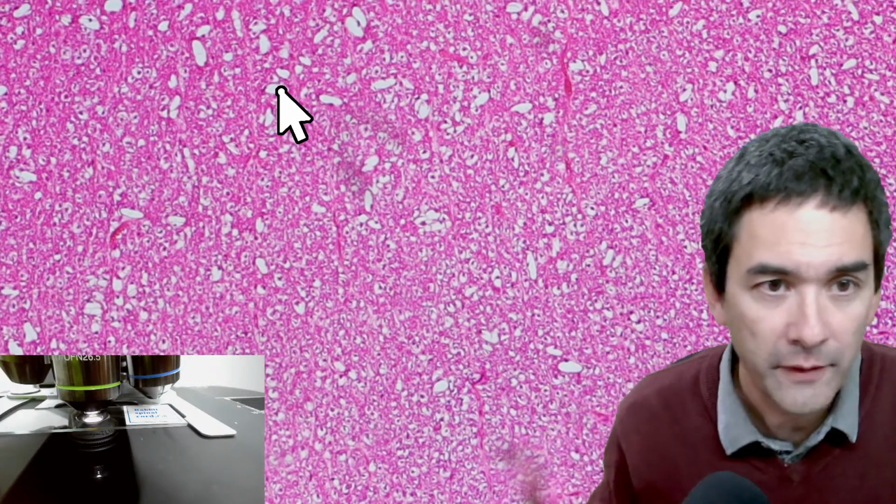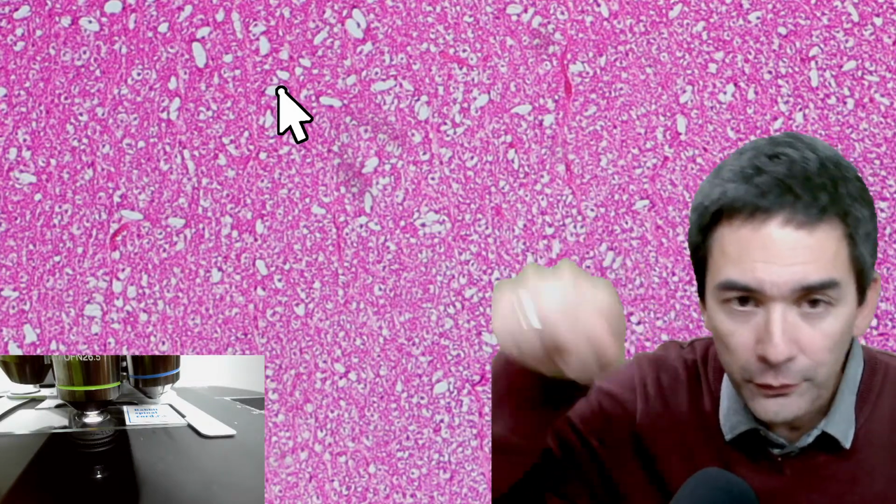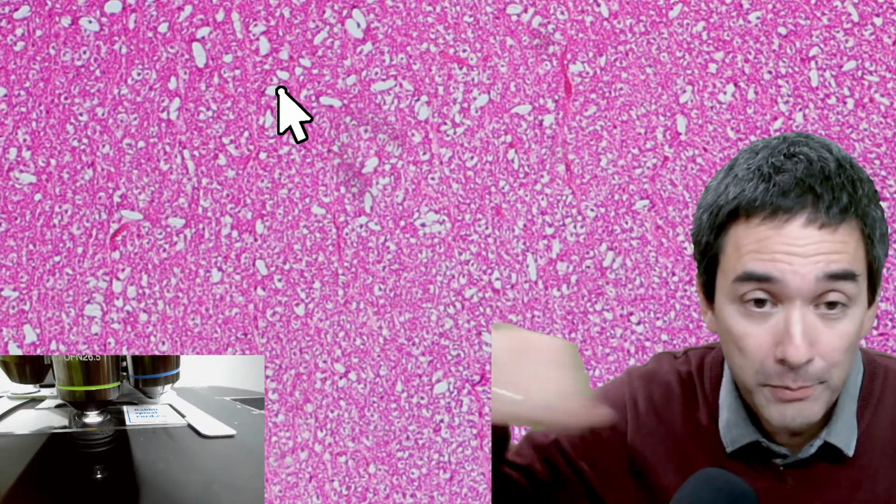What I would do in this case is probably not do this on screen like this, but actually take photographs, print them out, and maybe stick them together, and then do this on paper, because then you can actually check off and mark all of the blood vessels or all of the cells or whatever you want to count. That would be the way that I would do it for practical purposes. Because otherwise, if you miscount and then bump into it, you don't know where you left off.